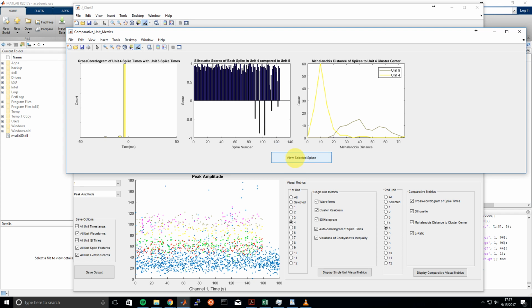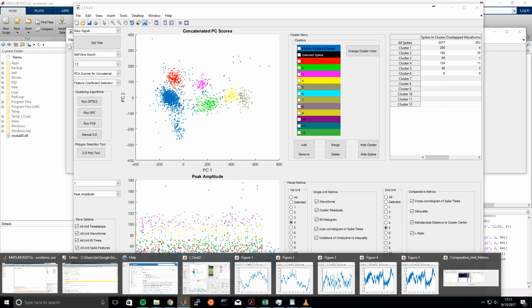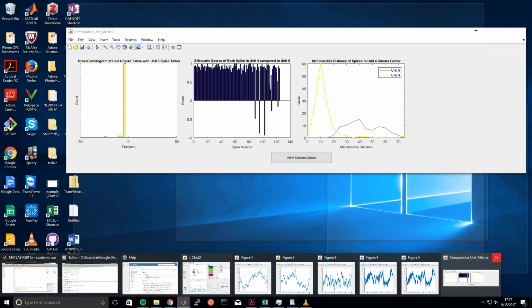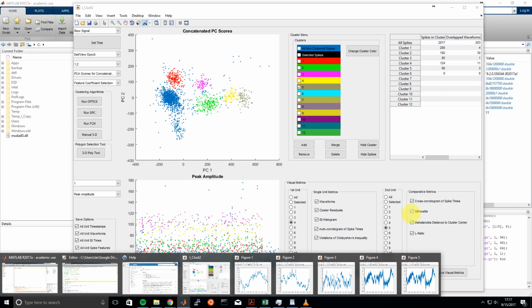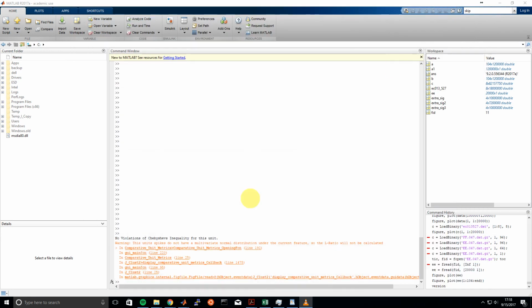So we can view these selected spikes, again, similarly to how we viewed the waveforms in the single unit metrics GUI. And these are the spikes that were actually closer to the Unit 5 cluster center. So we can add them over to Unit 5 if we choose so. And even though they actually look farther away from Unit 5, keep in mind that we're viewing this in a 2D projection, not the 4D projection that the Mahalanobis distance is calculated in. So we can go ahead and add those to Unit 5, for example.